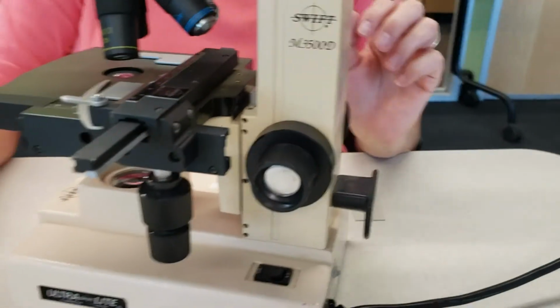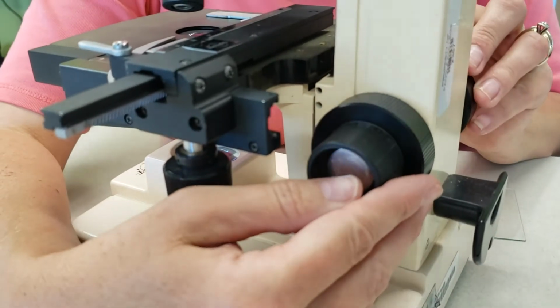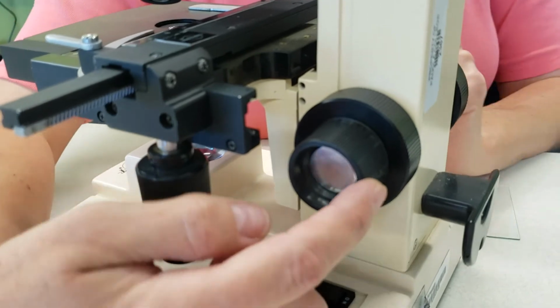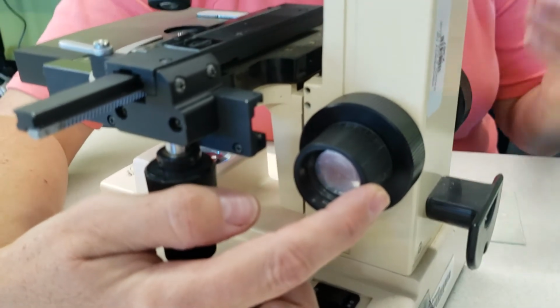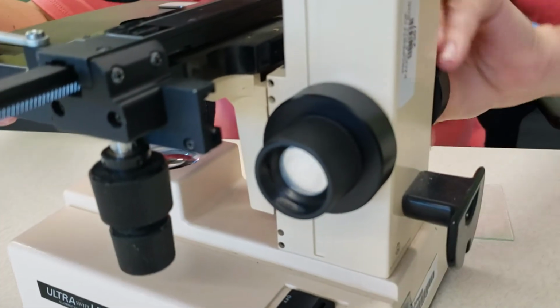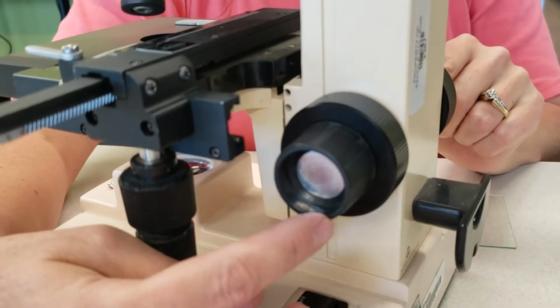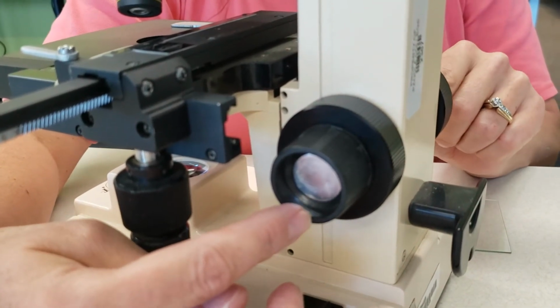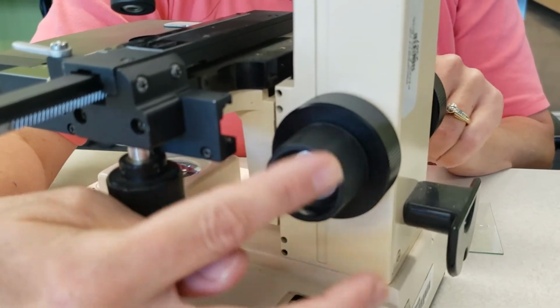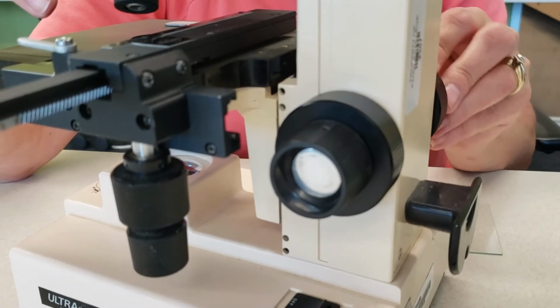You ready? Yes, ma'am. Okay, back here we have 2 knobs that are going to be involved in focusing. This larger one is called the coarse adjustment knob. So it's going to do coarse focusing or large focusing. So it's going to move this stage. You'll see the stage moving very rapidly up and down, large movements. This small one is called your fine adjustment or fine focus knob, and it's going to do very fine or small focusing. So you can see as I'm moving it, you barely see that stage moving up and down.